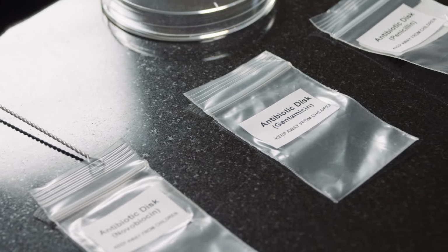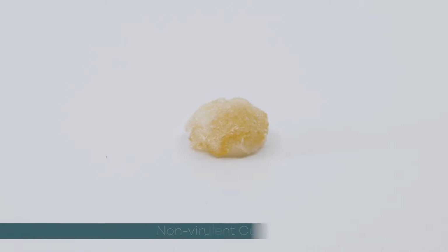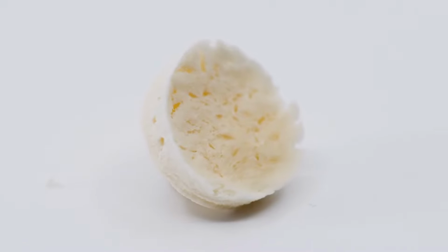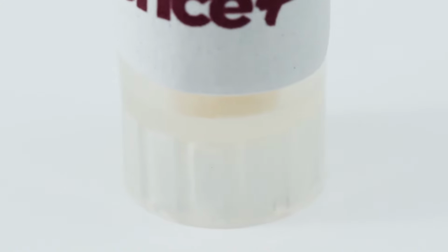In lessons such as aseptic technique, culturing microbes, bacterial morphology, and staining techniques, we provide students with E. coli and S. epidermidis cultures to learn how to culture and identify microorganisms. To ensure student safety, the cultures we provide are always pure strains of non-virulent microbes.